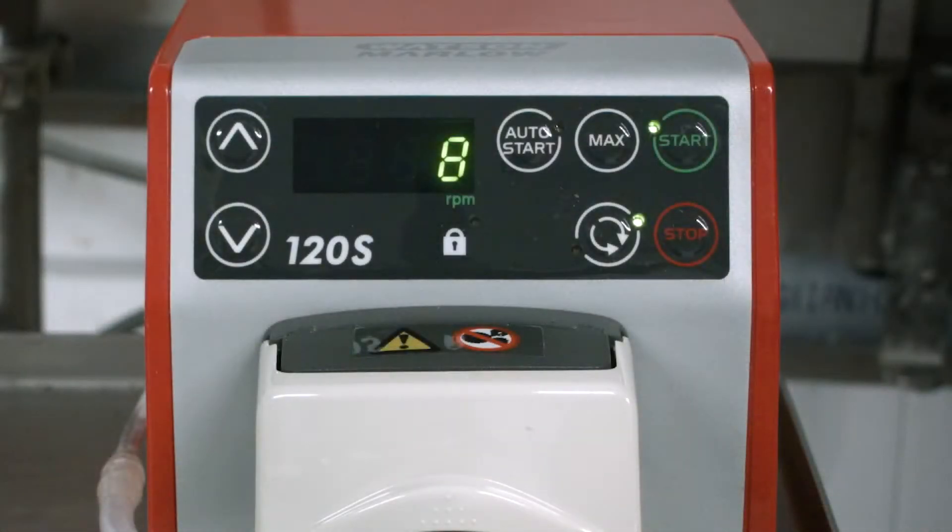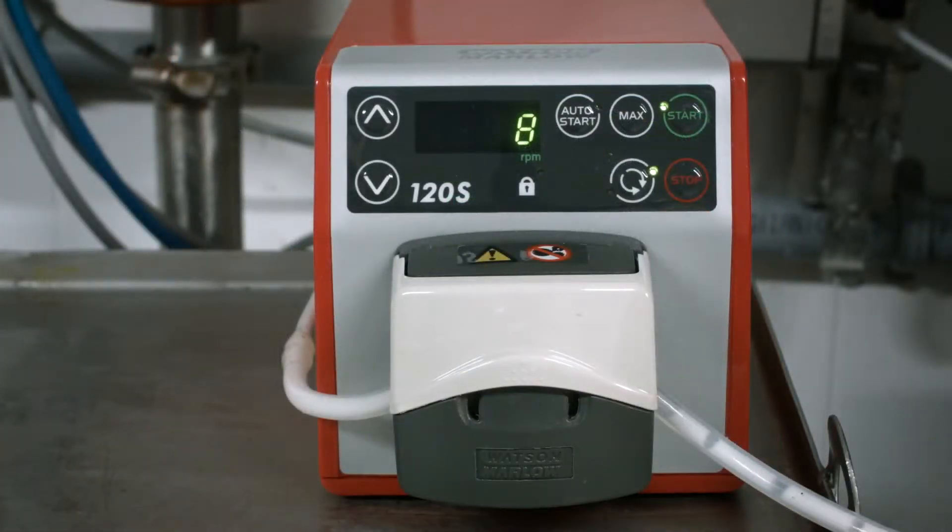Set the pump to the desired speed. After the milking cycle has begun, turn on the peristaltic pump. The peristaltic pump will pull a consistent volume of raw milk throughout the entire milking cycle.